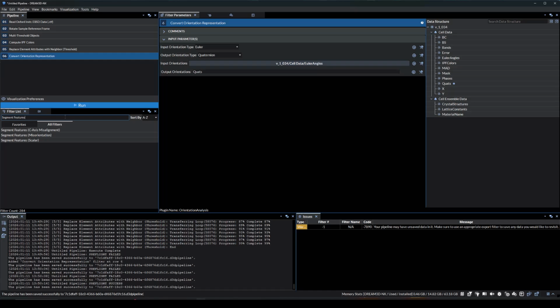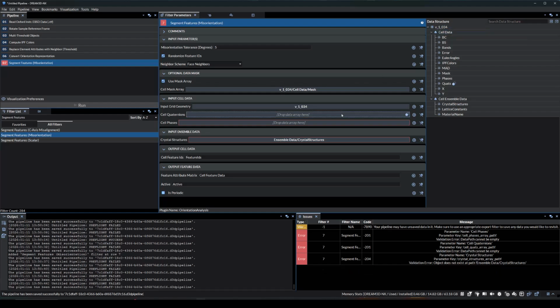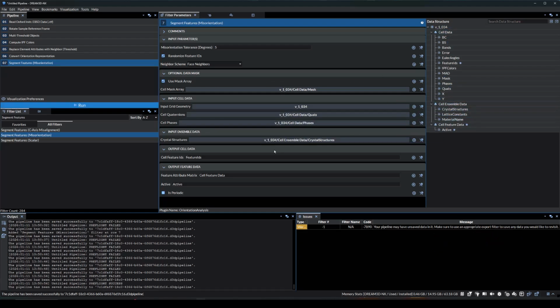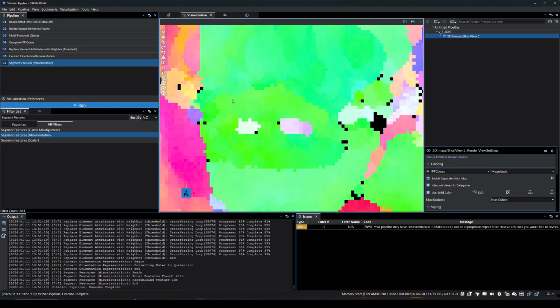Next, we'll add a segment features filter specifically with the misorientation. Enable Randomize Feature IDs and use Mask Array, then populate the 5 required path parameters. Once that is done, we can rerun the pipeline and view our feature IDs in the visualization.